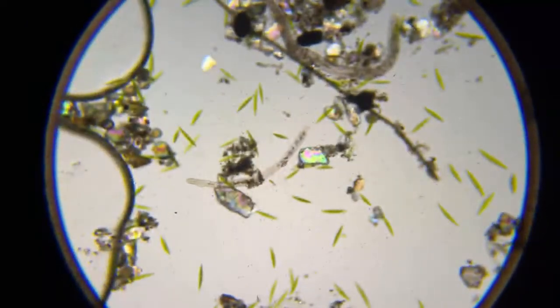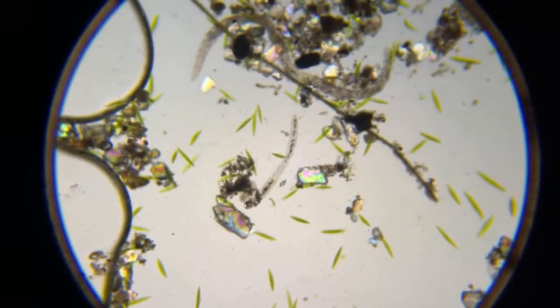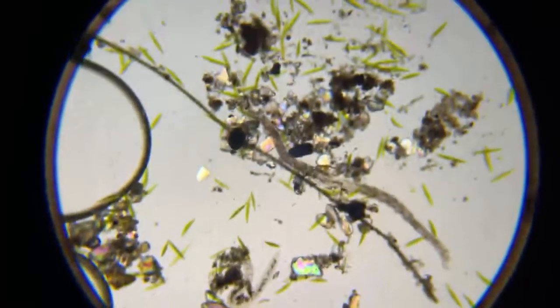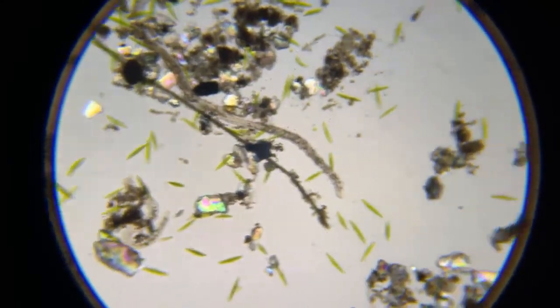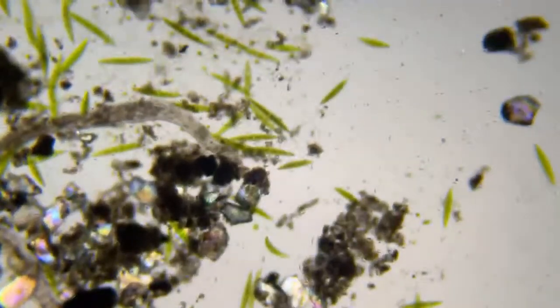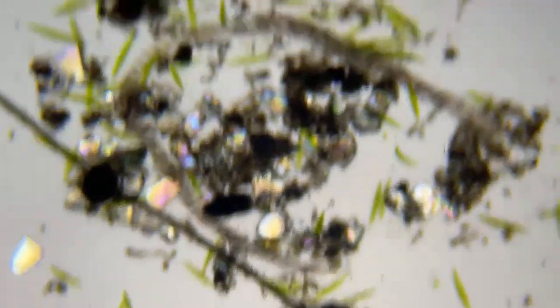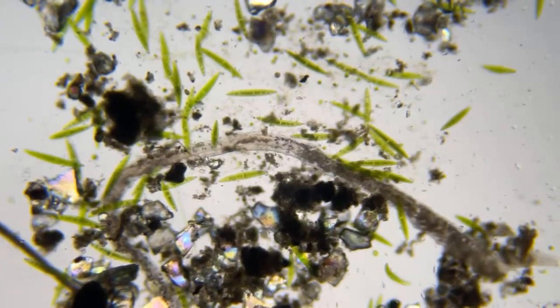So here's the annelid. Aeolosoma, I believe his name is Aeolosoma. Here's one that's bigger than him, but you can see he doesn't have a flat head like that guy. And since he doesn't have a flat head, he's a different species, but he's still segmented. Okay.